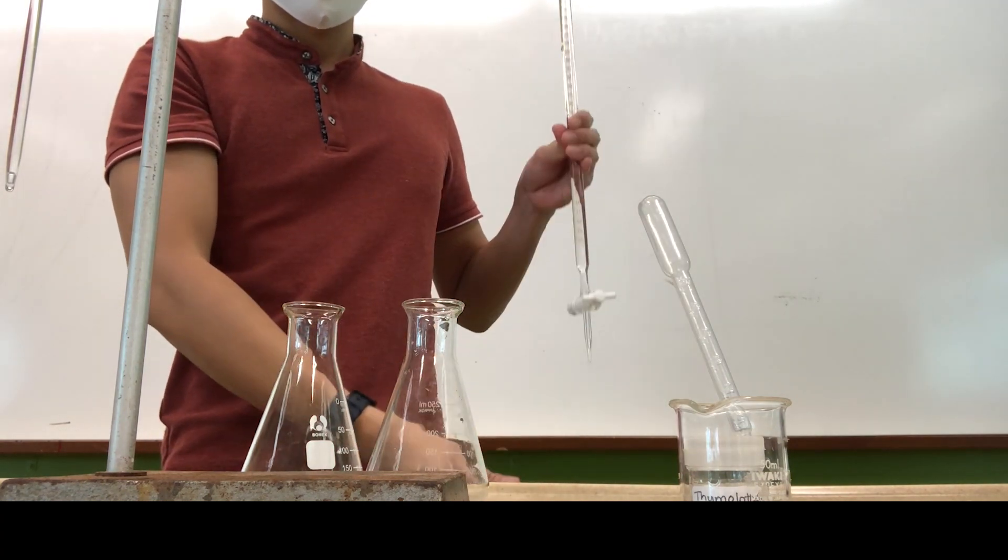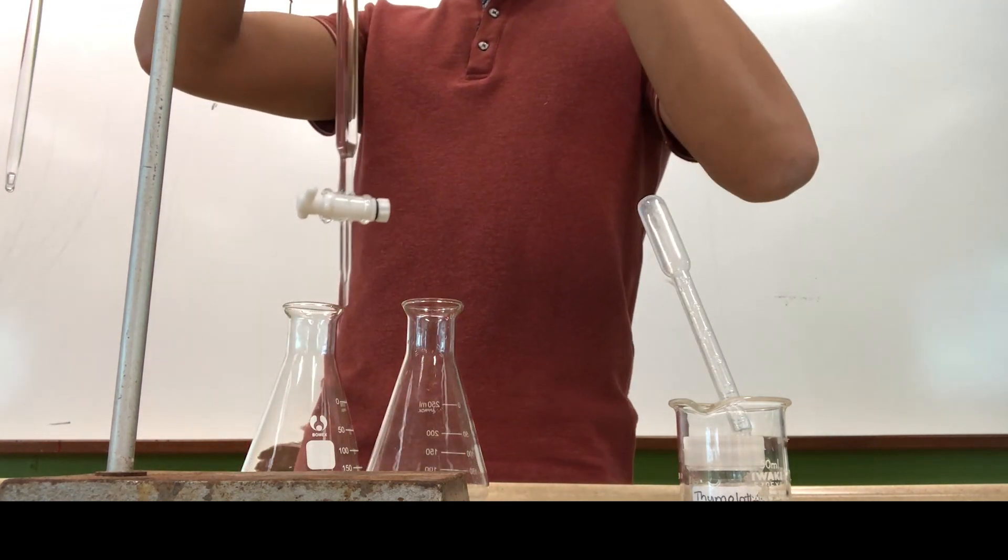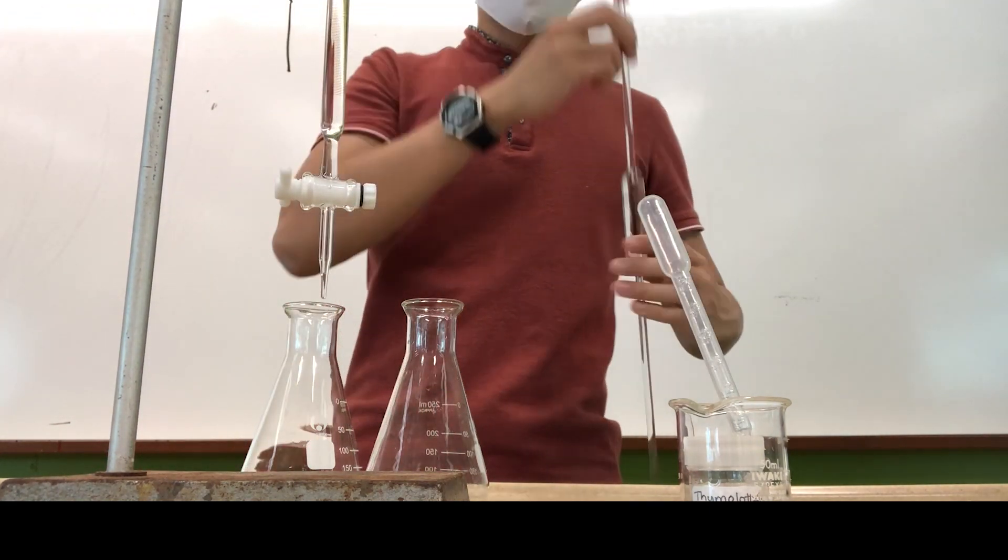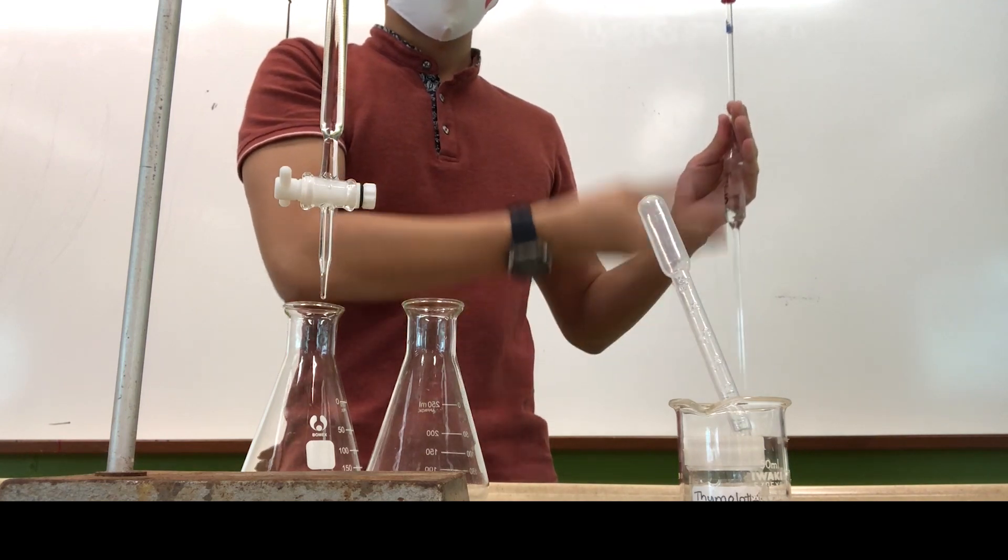So I've already filled my burette with the alkaline solution S. And I've also prepared a pipette of 25.0 cm³ of the unknown acid solution R.